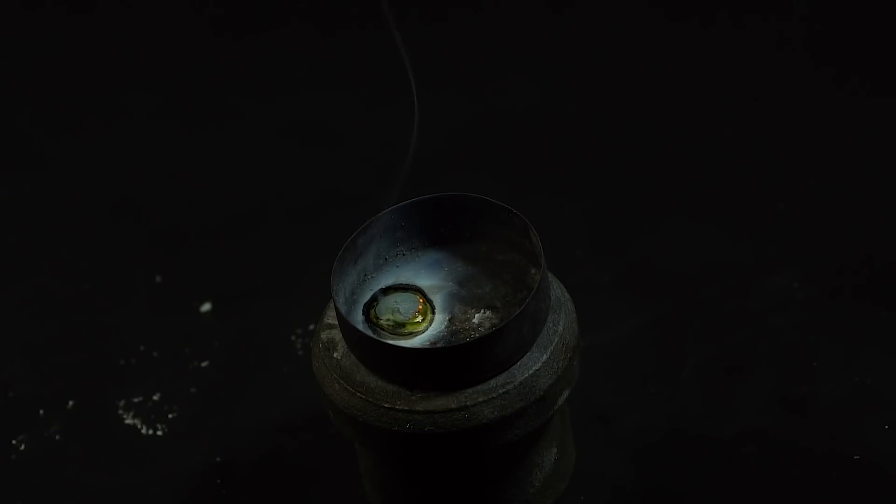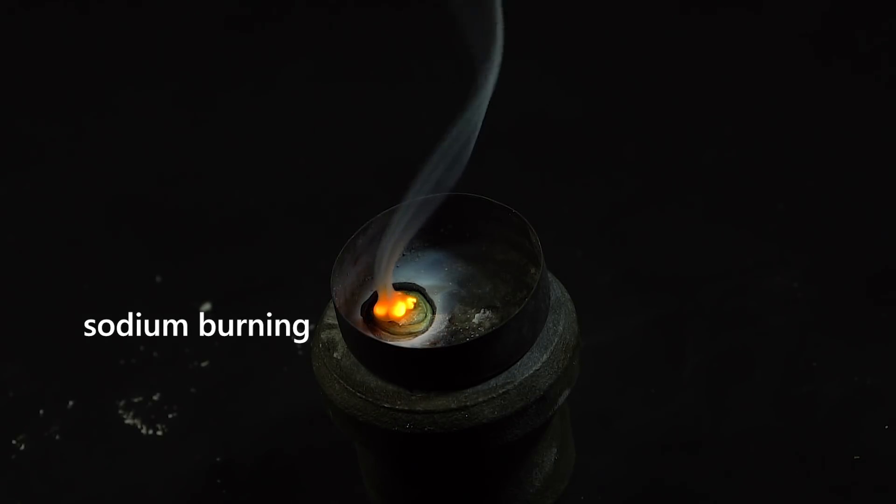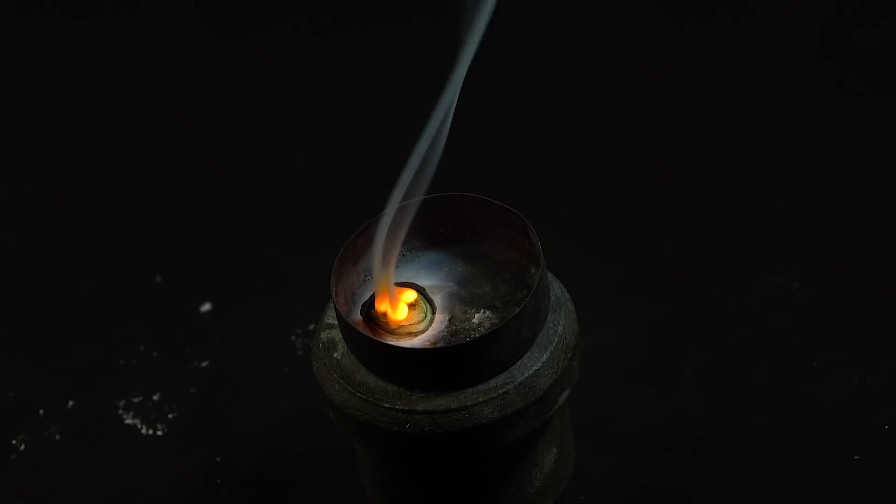At first glance, boron tribromide does not react with sodium or potassium under normal conditions. It does not interact with burning sodium either.